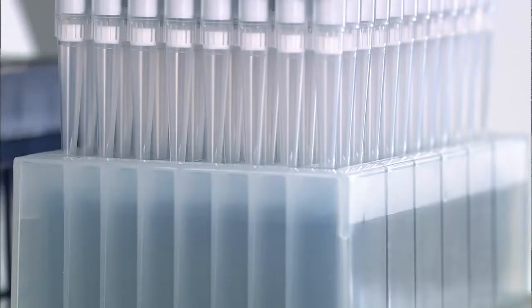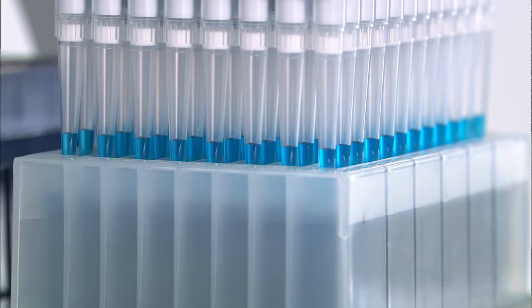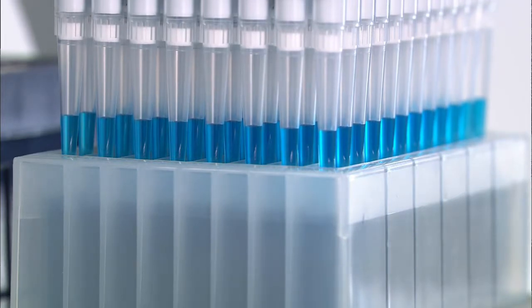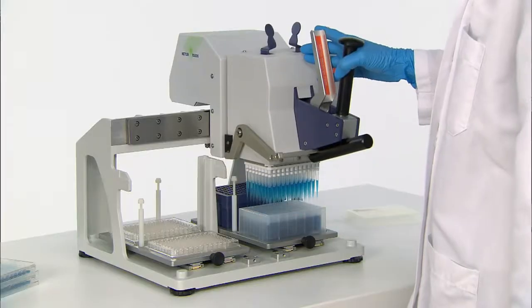After the pre-rinse, aspirate the liquid slowly. A great feature of the Liquidator 96 is that you can control the speed of aspiration and dispensing depending on the type of liquid you are handling.